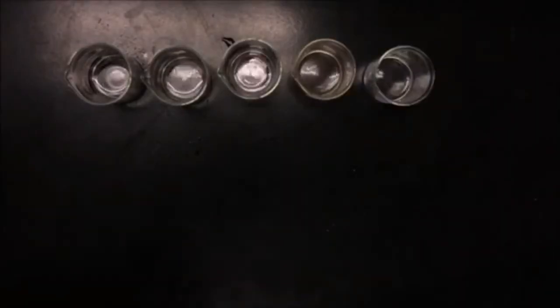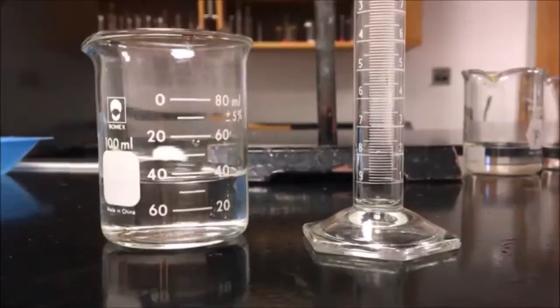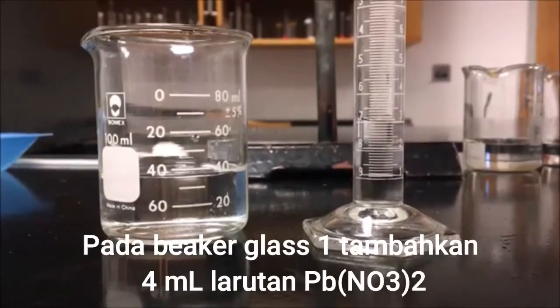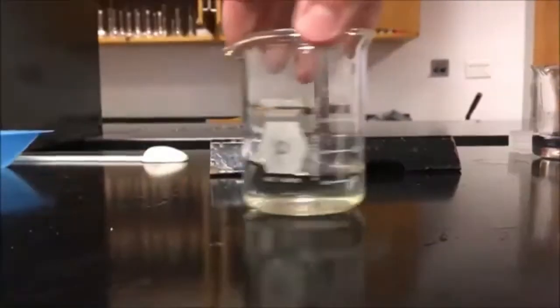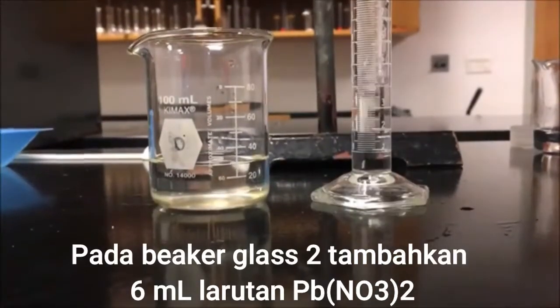Line up all your beakers from most water to least water and get ready to add lead 2 nitrate. For the first beaker, add 4 milliliters. For the second, add 6 milliliters.